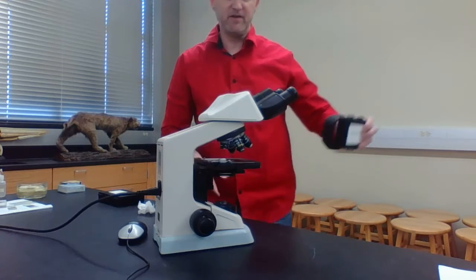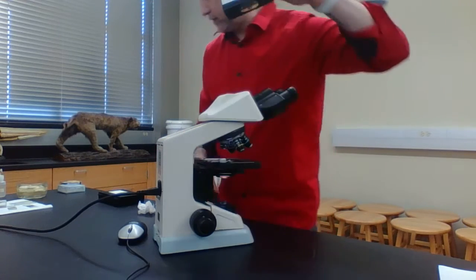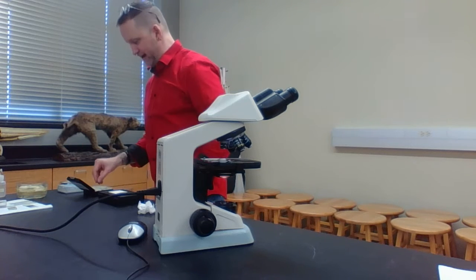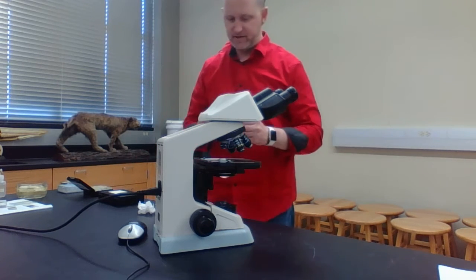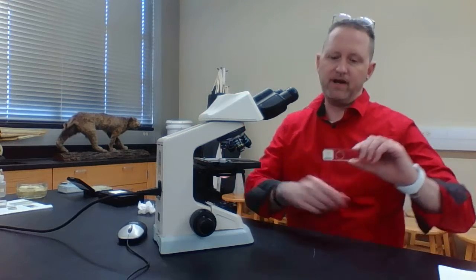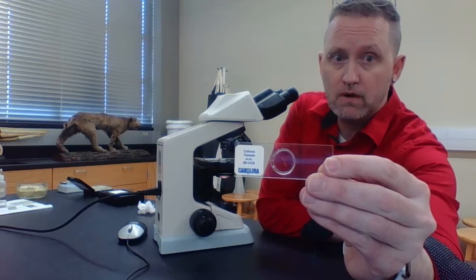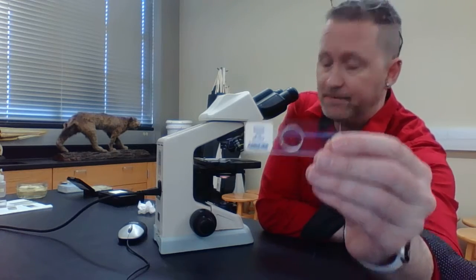Now the next exercise I want you to look at is this one right here, exercise B. This is something referred to as the colored threads. Make sure the letter E is put back in the slide box, and when I pull this out, these are the colored threads. There are actually 3 colored threads here: blue, red, and yellow.